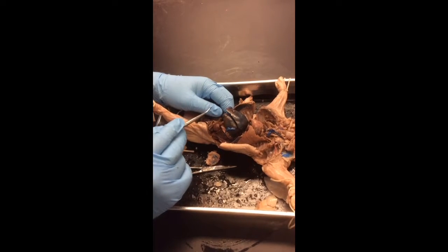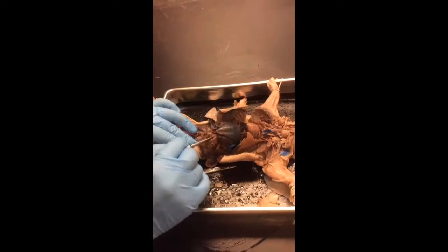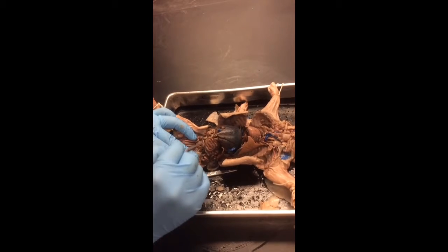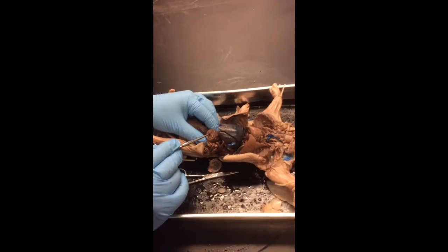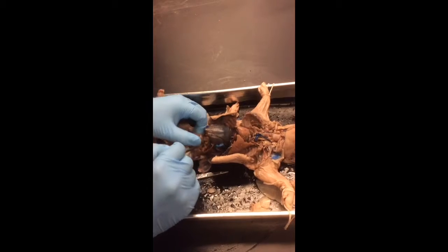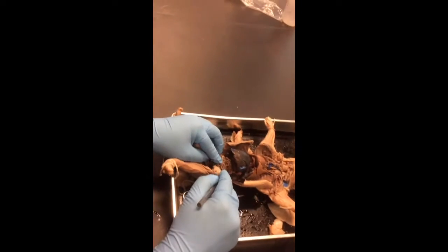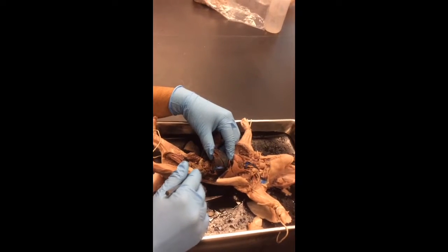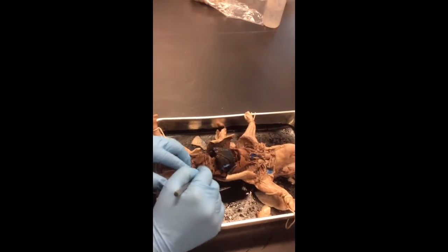Pyloric sphincter, you won't need to know. It's at the end of the stomach. It's a valve. The small intestines are over here, right? The smaller, looser ones. When it becomes the large intestine, you'll see it start to coil up, like right here, okay? The pancreas, you won't have to know it for the test, but it's below the stomach and above the large intestine. It's this thing right here. The pancreas in humans, though, is at the small intestine, so it's different.